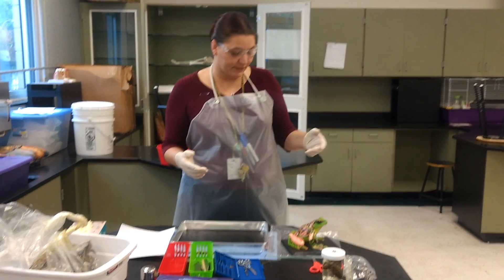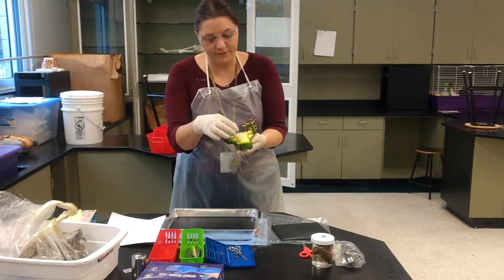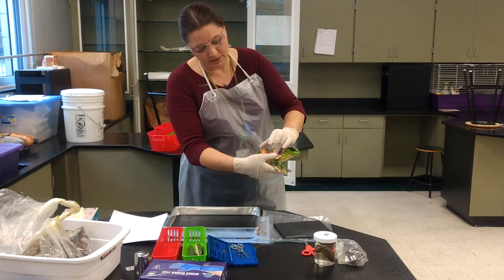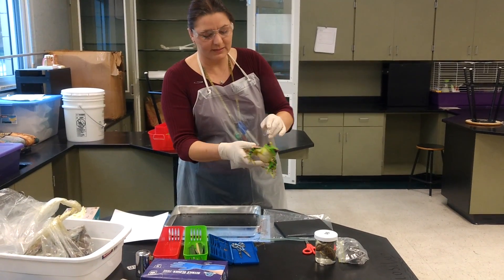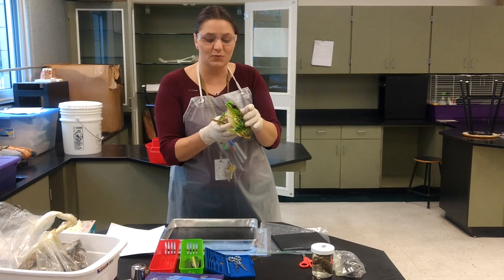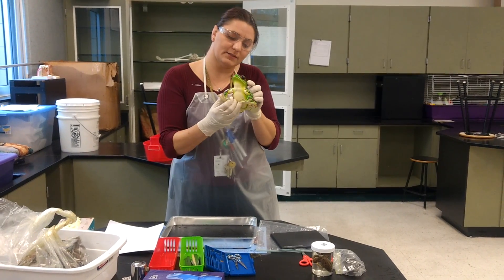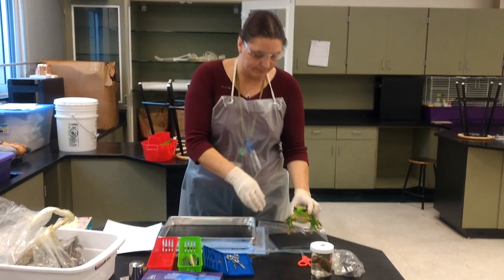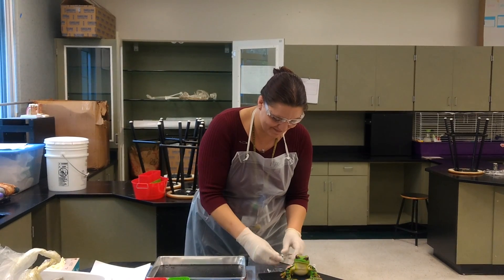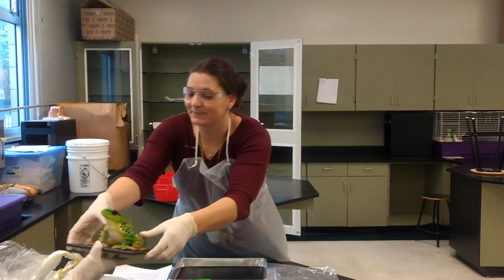I have put together a model of a frog, and Sam put it together for us — open it up and look at the organs inside. For those of you who really don't want to touch actual frog organs, you can use this model. All right, let's see if I can put it back together — maybe not. You go Sam, here's your masterpiece, thank you.